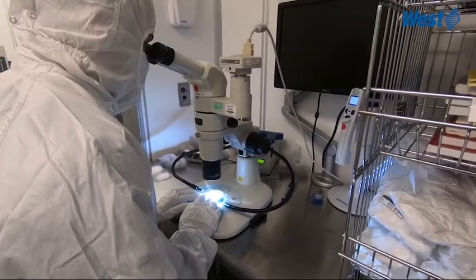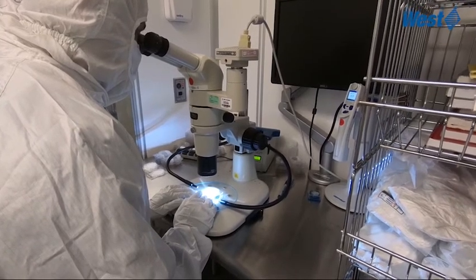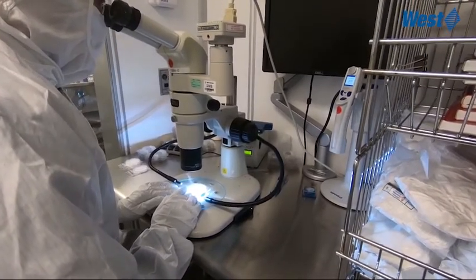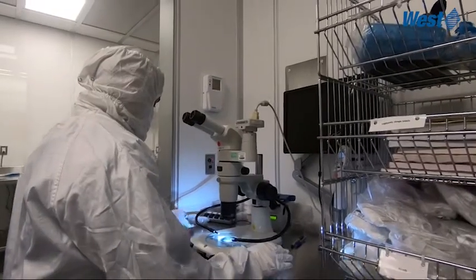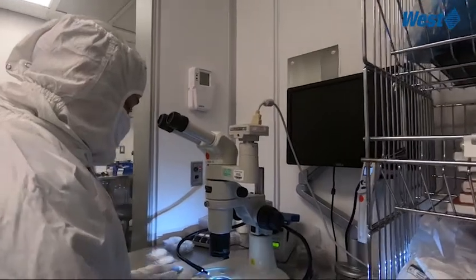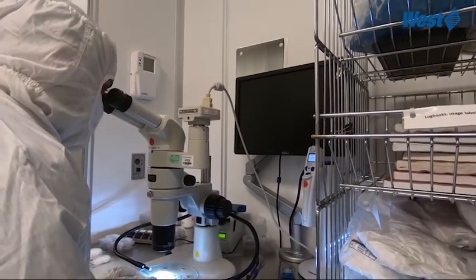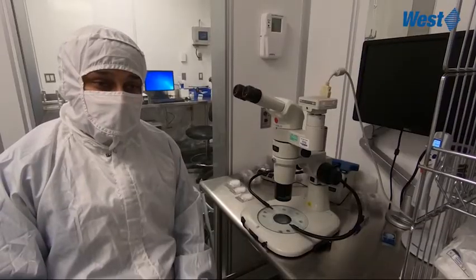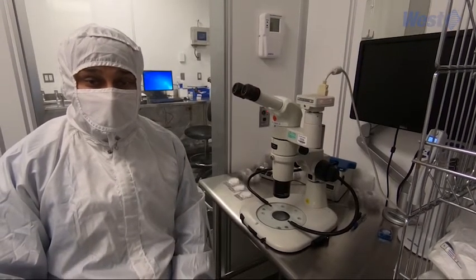This involves pooling the sample drug product vials into a flask or a beaker. The pooled drug product is then filtered through a gridded filter, which is then inspected using a microscope at 100x magnification. Particles greater than or equal to 10 microns and greater than or equal to 25 microns are counted using that microscope and a criteria that is specified in the chapter.